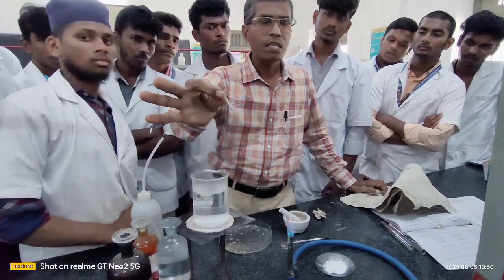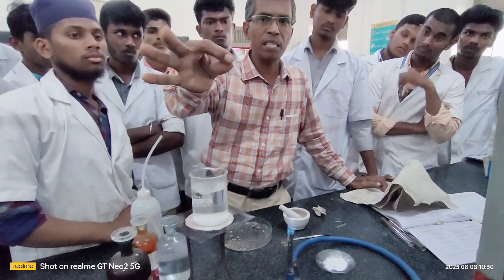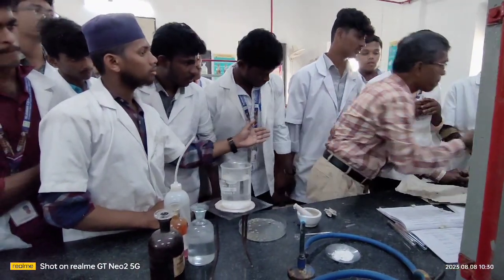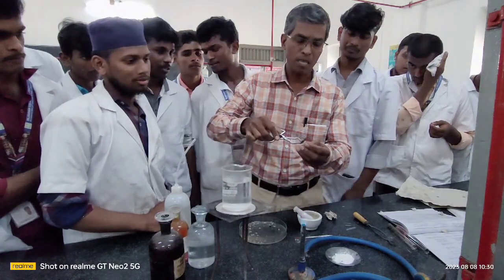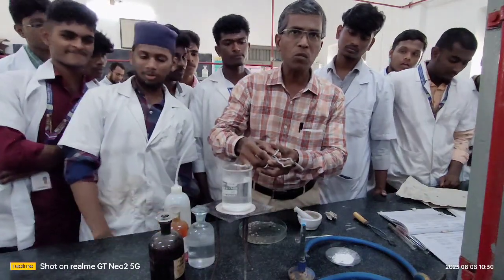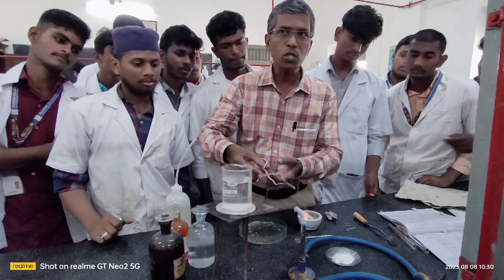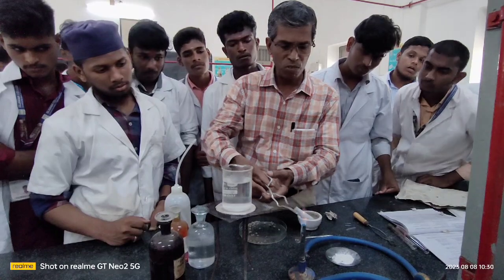Now see this, the fusion tube is now filled with a little sodium metal. Before you take the organic compound into this, hold the fusion tube with the help of your nickel tongs, and now gently try to melt down this sodium taken in the fusion tube. Don't rush suddenly. Slowly you try to melt down the sodium taken in the fusion tube.